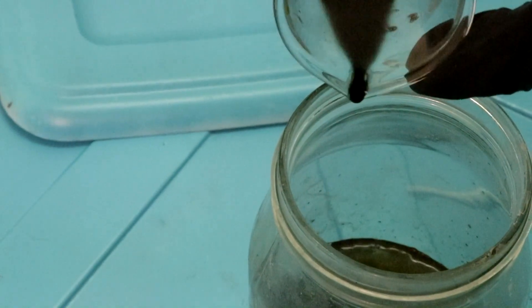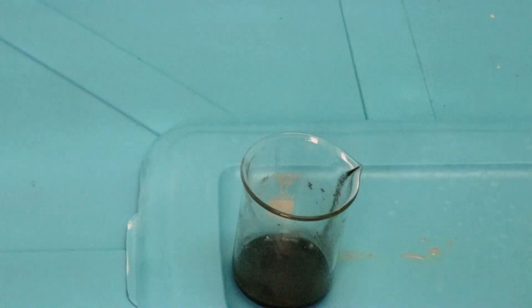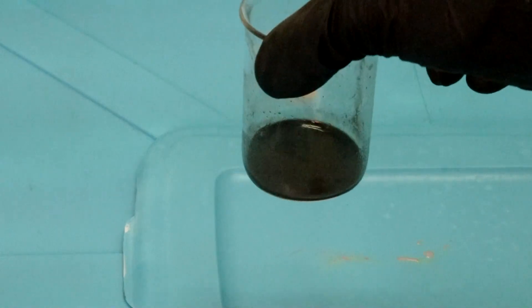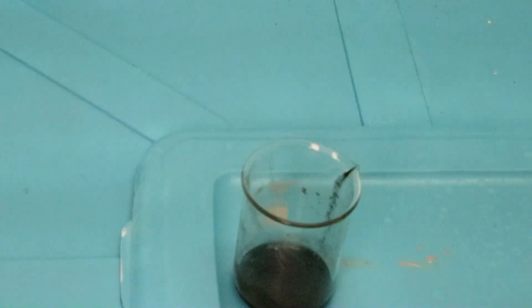Of course you'd probably be better at decanting than this. And then you'd add more hydrochloric acid and nitric acid to dissolve gold. Unfortunately, you would never recover any because you just poured off your gold into your waste.